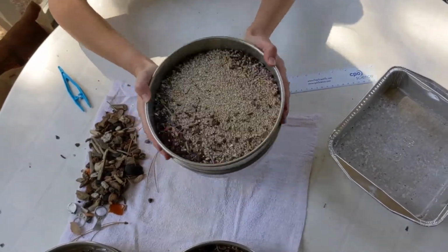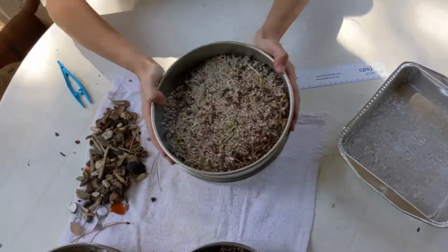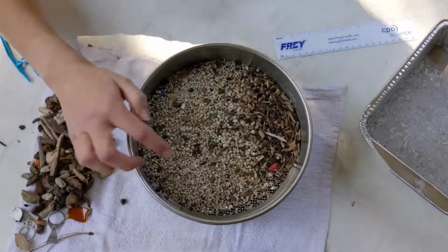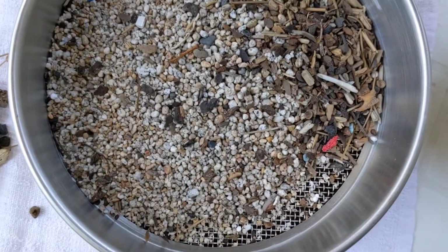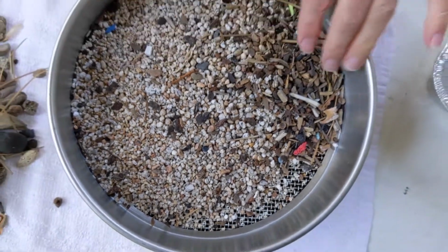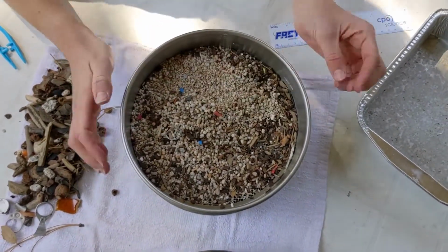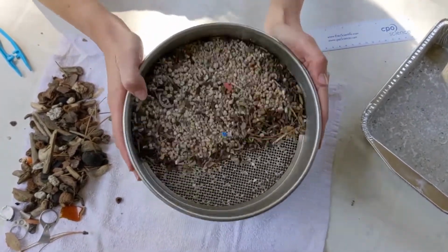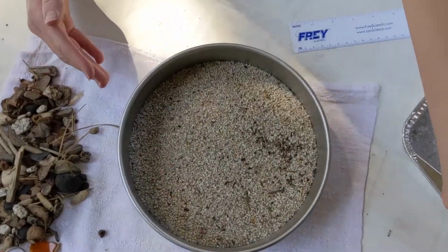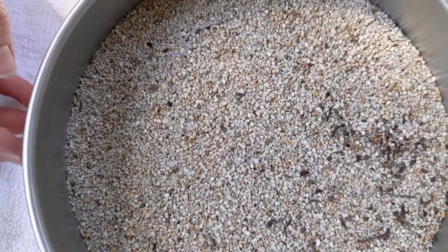As you can tell, they get harder and harder to see as you go because they're getting so small at this point. And some of the sneakier pieces are these styrofoam pieces that kind of look like little pebbles. So you can see sometimes you might miss a piece of microplastic thinking that it's organic material. These sieves are really useful in sorting those out. And underneath this final sieve, we have mostly sand, but also something called nanoplastics. Nanoplastics are so tiny that you would need a microscope to see them.